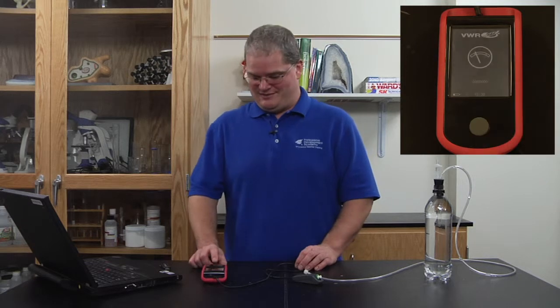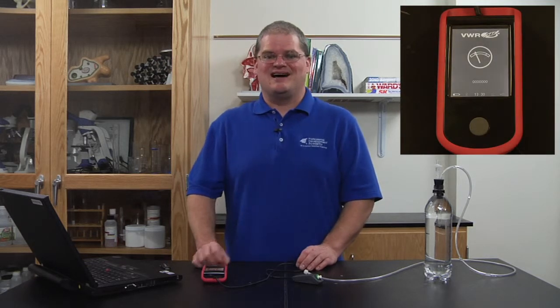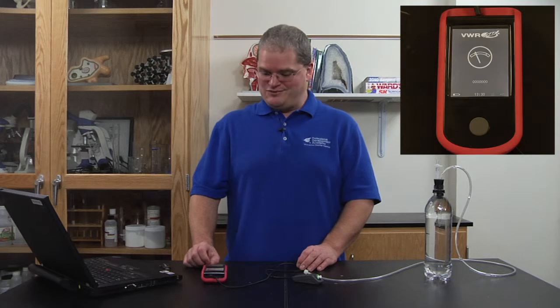I'll begin by showing you how easy it is to turn the gas pressure probe on by pressing the button at the bottom of the unit. Next, I'll touch the screen and it moves the data collector to the home screen.